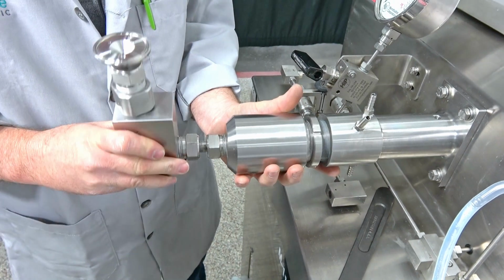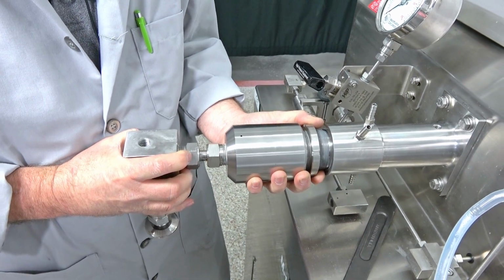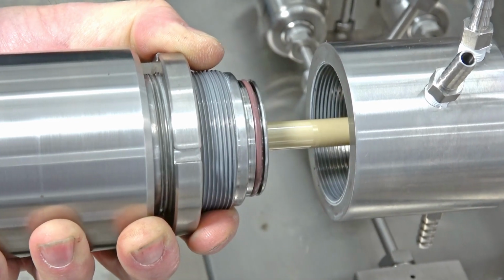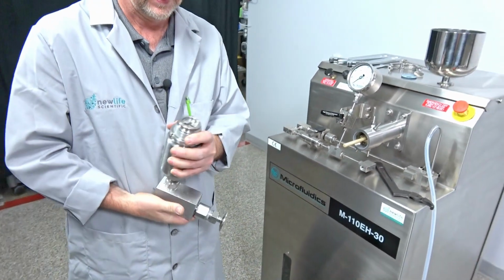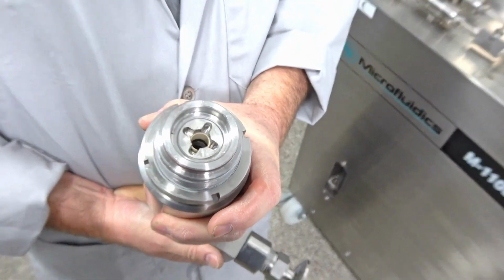Just waiting for that last thread to break loose. And there we are. You can see it right there. So then we just pull this out really slow like that off that ceramic plunger. So there's the ceramic plunger. And then here's where we've got to get in with our other spanner wrench. That's kind of a specialty tool.